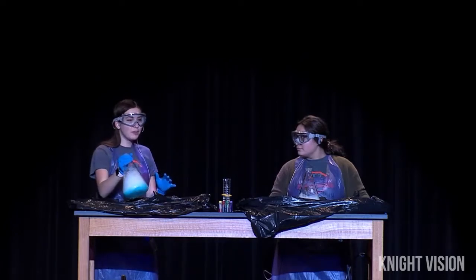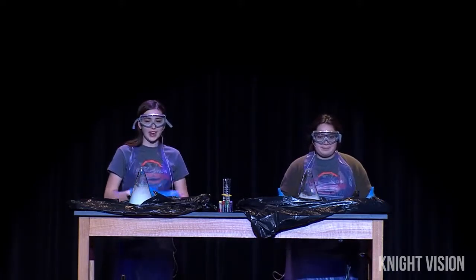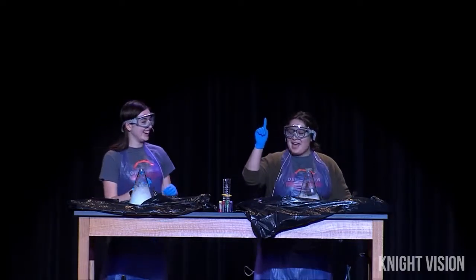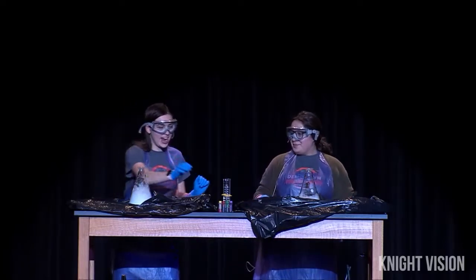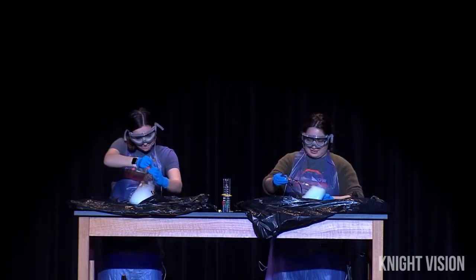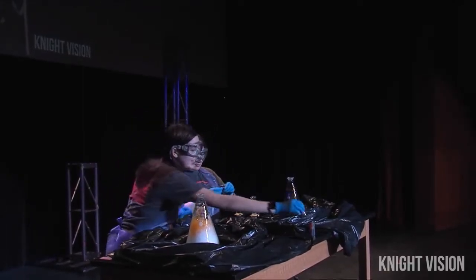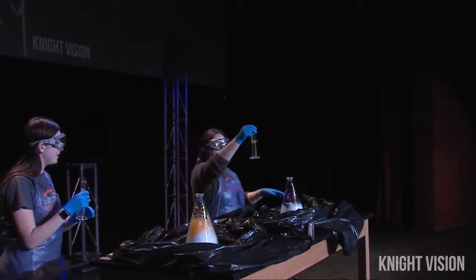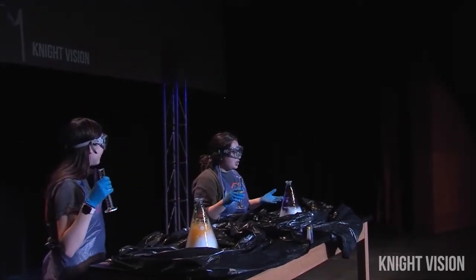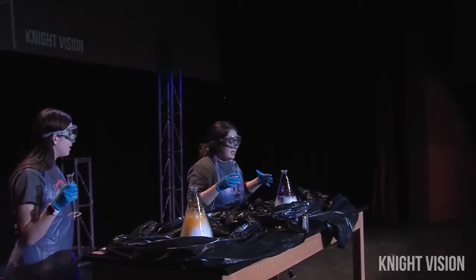So we've already added 150 mils of our 30% hydrogen peroxide, which is that strong reactant I was talking about. And we also already added a bunch of soap so that later on it can become foamy. Now here's the fun part — you guys get to choose what color we're going to make our elephant toothpaste. We have purple, green, red, and yellow. So we're going to add our dye in — let's make this really beautiful. Now that we have the dye in, it's time for our final ingredient. Here we have 30 milliliters of potassium iodide. This potassium iodide acts as a catalyst, so it speeds up our reaction, and it also degrades the hydrogen peroxide that we already added, making it water and oxygen. And this oxygen gets trapped into the soap that we already added — so let's see what happens.